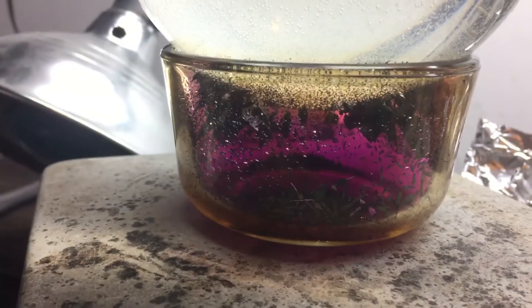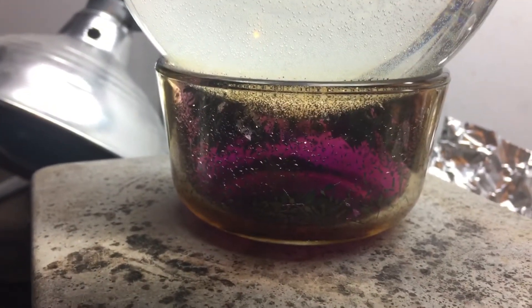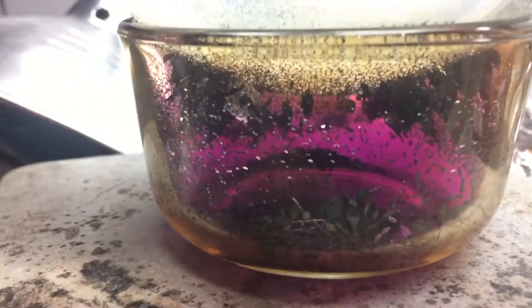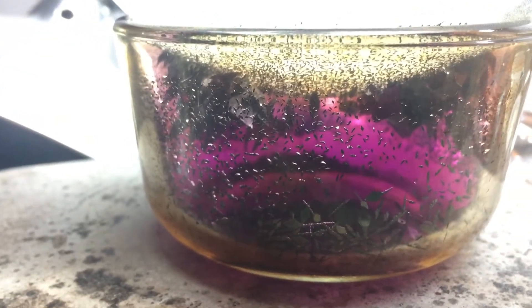After a while it's getting pretty hard to see in the flask with video, so I'm going to stop the time lapse and show the crystals after they've gone to their full extent. It's pretty interesting the growth they've made so far — they started to cover the glass on the outside too, so the video quality really wasn't that great.